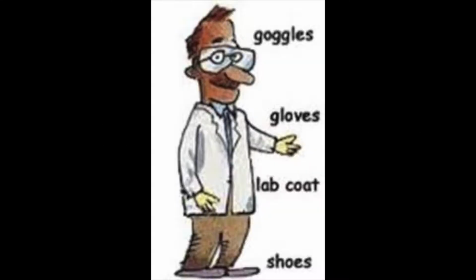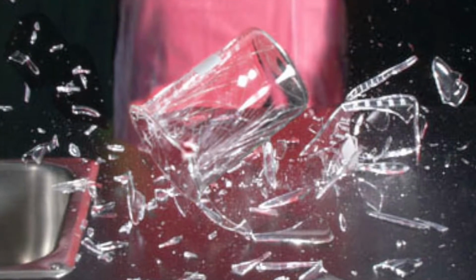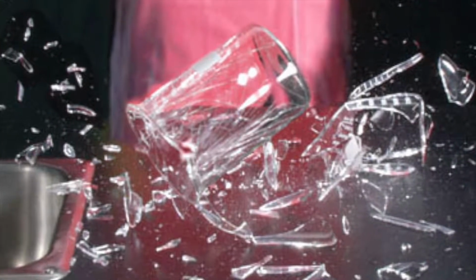Lab personal protective equipment is required to conduct this experiment. This includes goggles, gloves, lab coat, pants, and closed-toed shoes. Broken glass is a hazard of this method, as the heating element is in contact with the glass. This could lead to spillage if the boiling chamber is broken. It is important not to turn on the heating element when the boiling chamber is empty to avoid breakage.